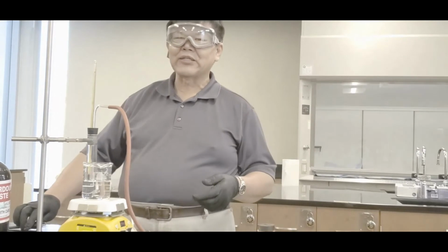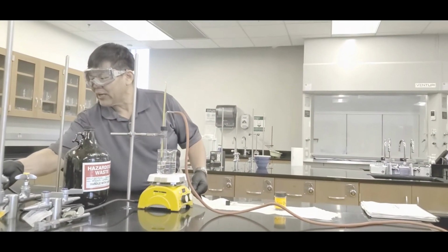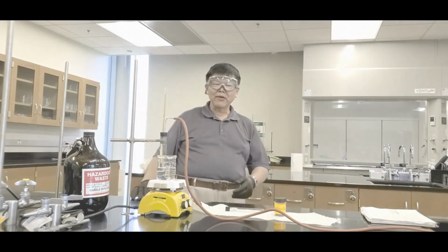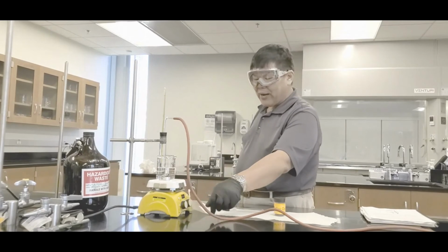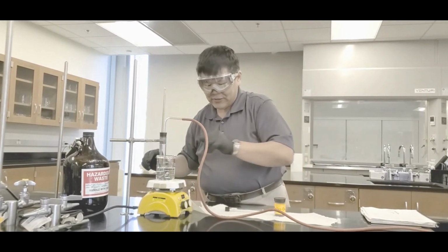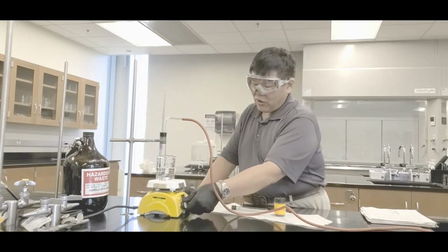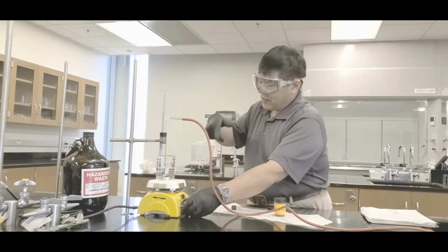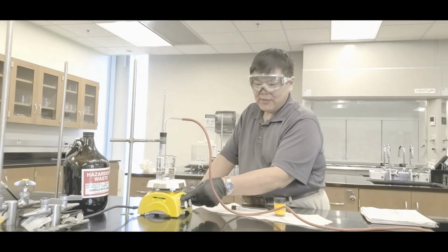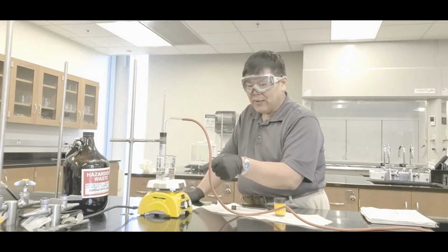Now that everything's set up, I can plug it in. So therefore, electrical plug in. So never plug it in until you've got everything totally set up. Okay? All right. Now that it's plugged in, that left knob, what you do is turn it all the way clockwise. And then you'll get a green light right there, yeah? That tells you it's on. So from now on, do not touch the white spot, okay?